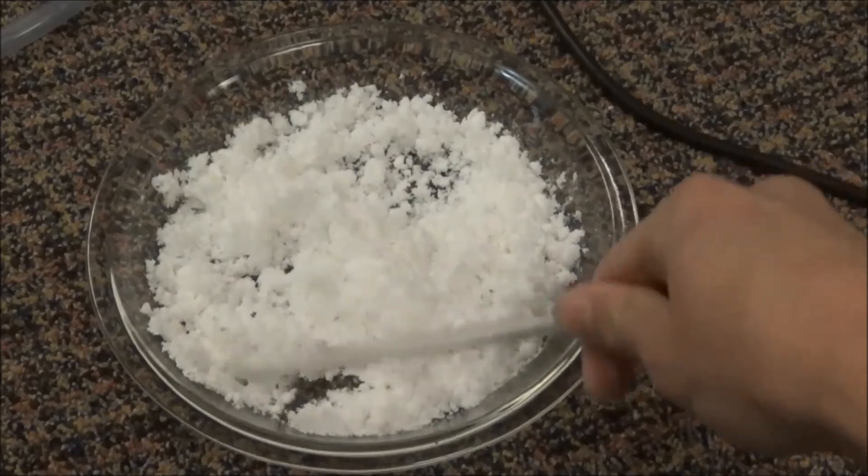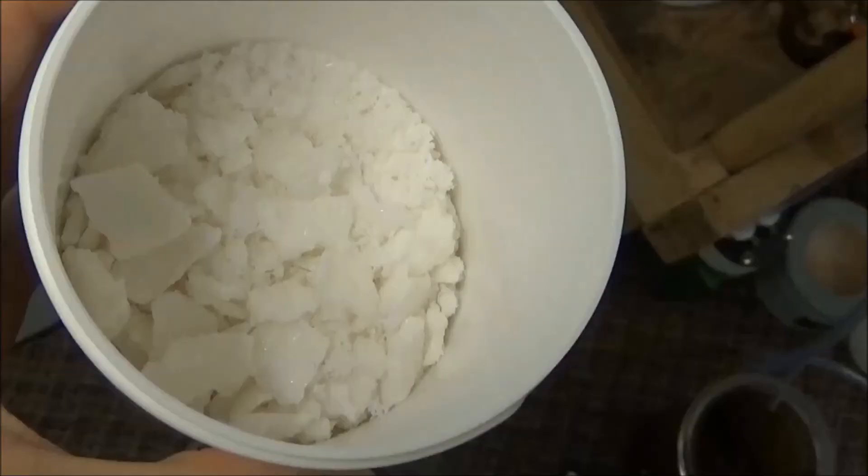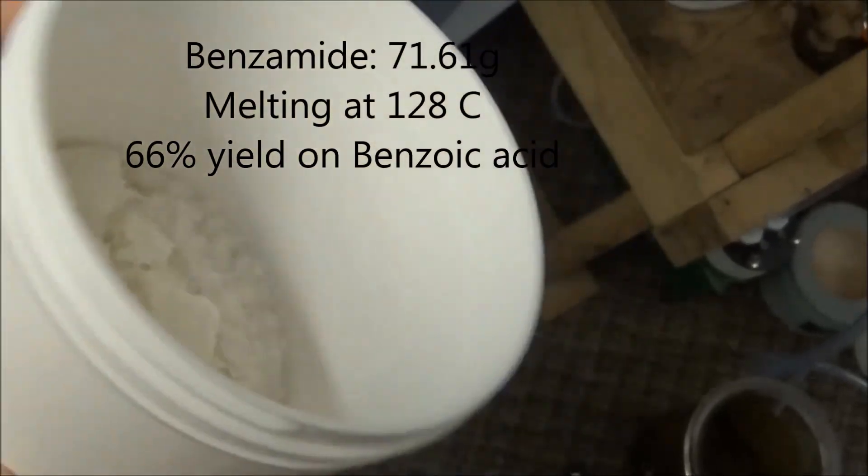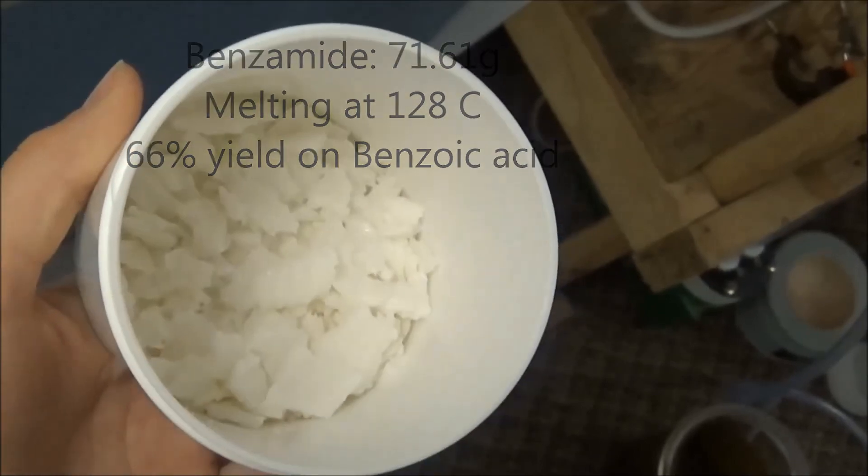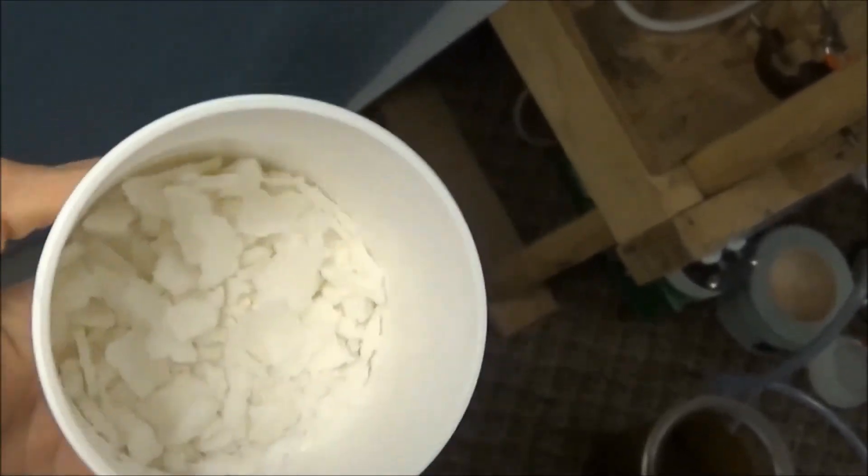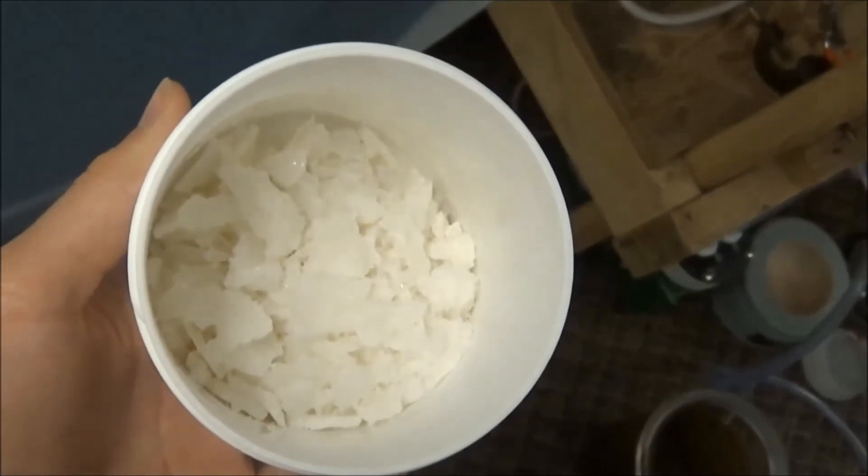My final product was 71.61 grams of some very nice benzamide. The melting point of 128 degrees Celsius confirmed its identity. The yield of 66% is somewhat low, but it should be more than enough for the preparation of aniline.